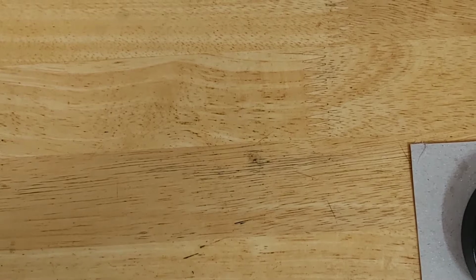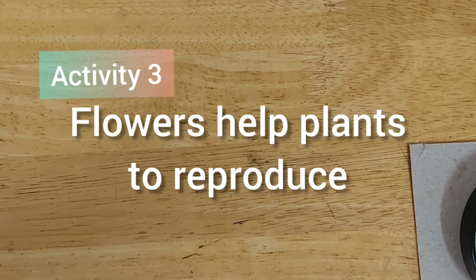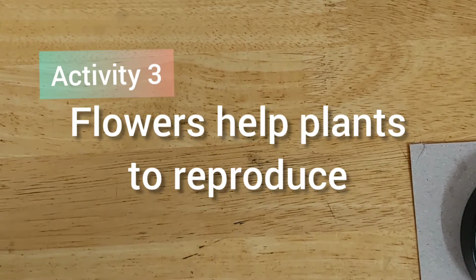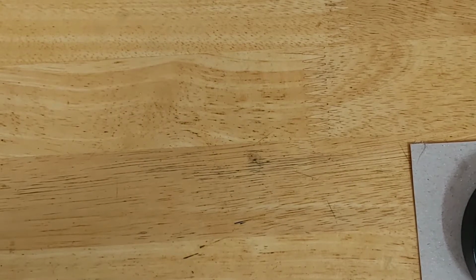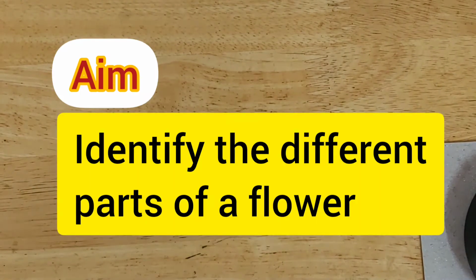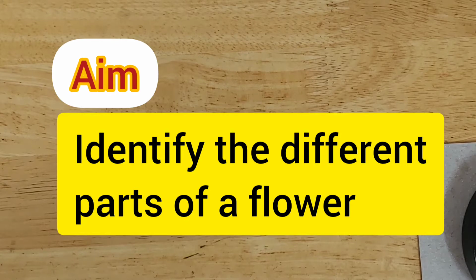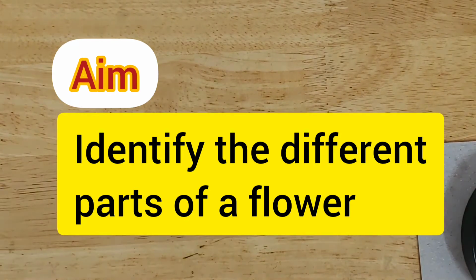Hello everyone. So today I am going to demonstrate activity number 3, which is all about 1.4 flowers help plants to reproduce. The aim of our investigation is to identify the different parts of a flower. Now, what are the things that we need?